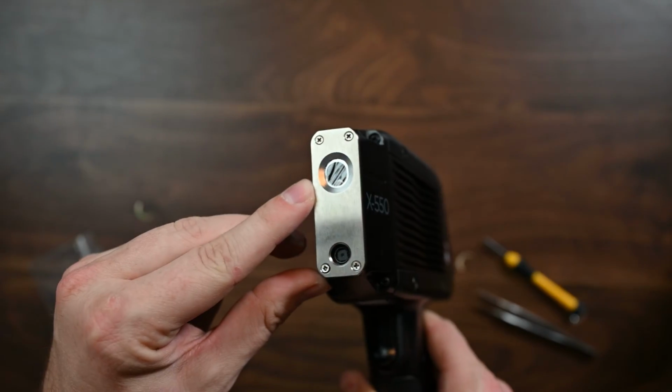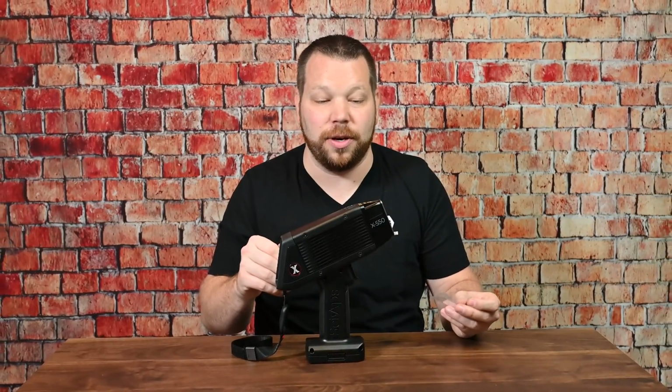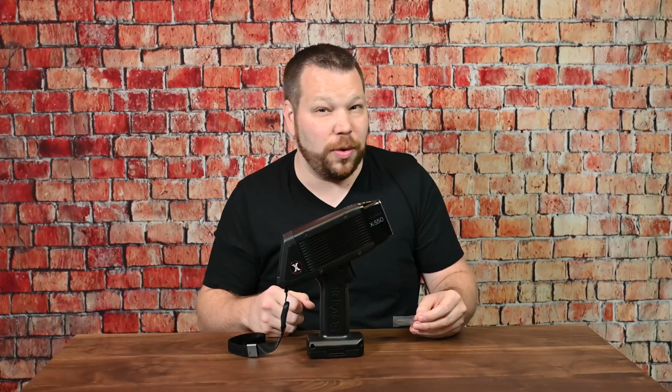This video is a tutorial for how to put a new window in your SciAps X-550 handheld XRF analyzer. You're going to find out it's pretty easy and there's just a couple of short steps, but I'm also going to teach you a couple tricks along the way to make sure that you're successful and your analyzer works as intended. Let's get right into it.